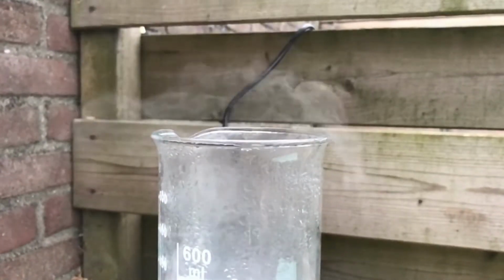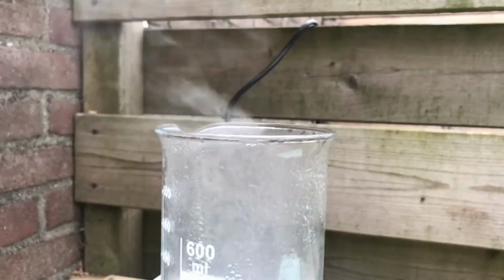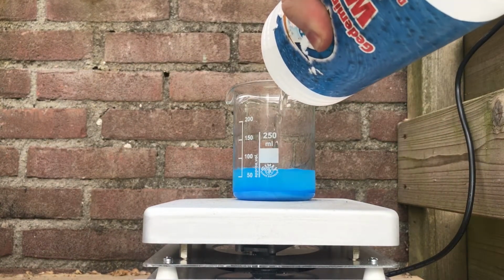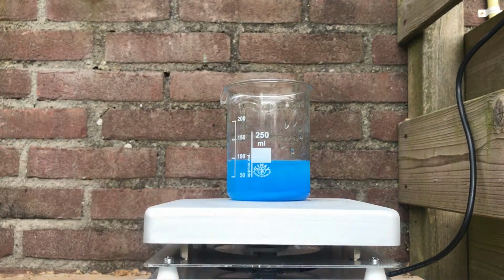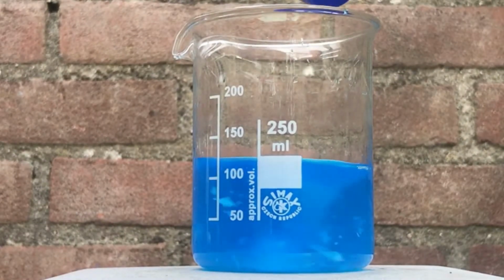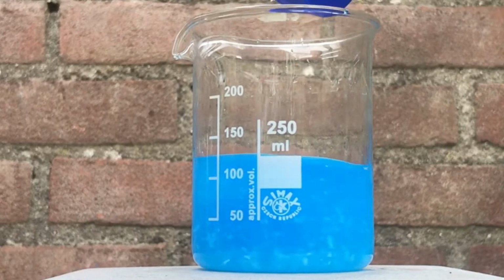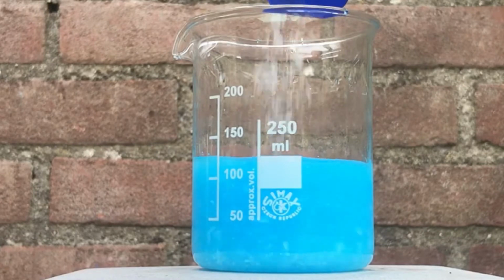We will begin with the preparation of sulfuric acid via the oxalic acid method. So let's begin with the synthesis. First, weigh out 22.5 grams of copper sulfate pentahydrate and dissolve it in about 100 milliliters of water. When all your copper sulfate has dissolved in the water, add 11.5 grams of oxalic acid dihydrate. This should precipitate white bluish copper oxalate and make sulfuric acid in solution.